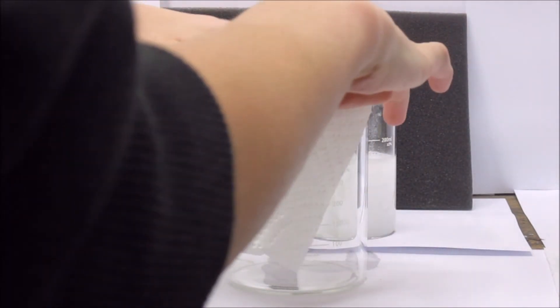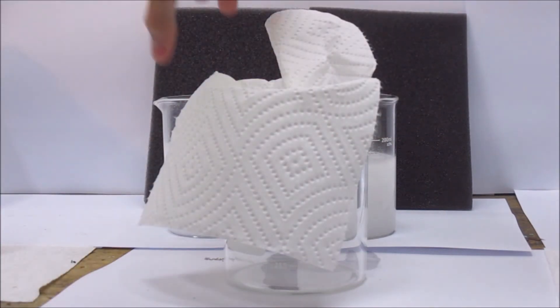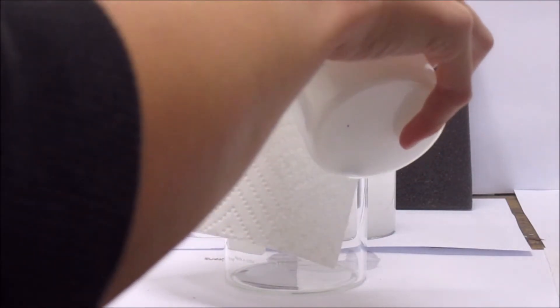I then put a paper towel on top of the new beaker to act as a filter, and then I poured the solutions through the filter.